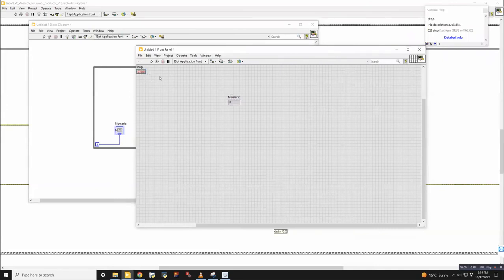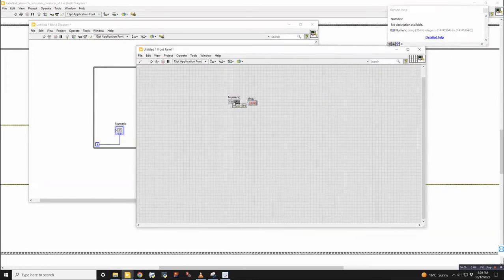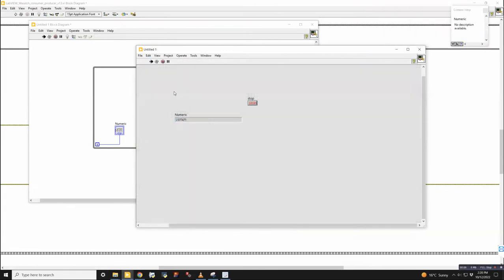If I can get this running. So if I run this, you can see how crazy that is. I should actually make this bigger. With respect to the rest of the software, it just slows things down because it's moving unnecessarily quickly. Yeah, okay.